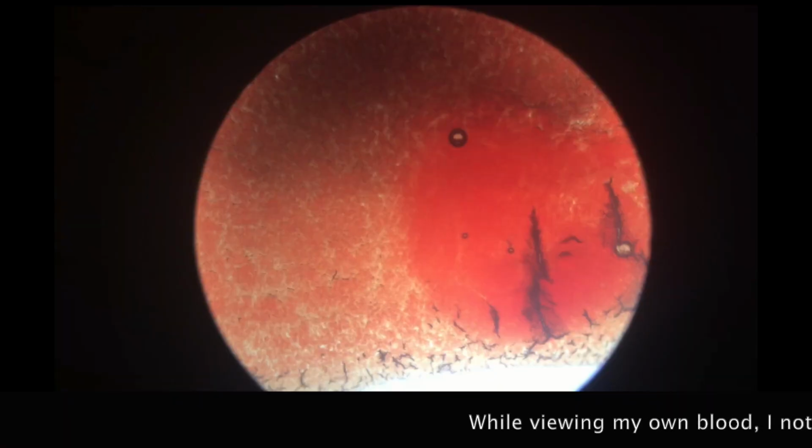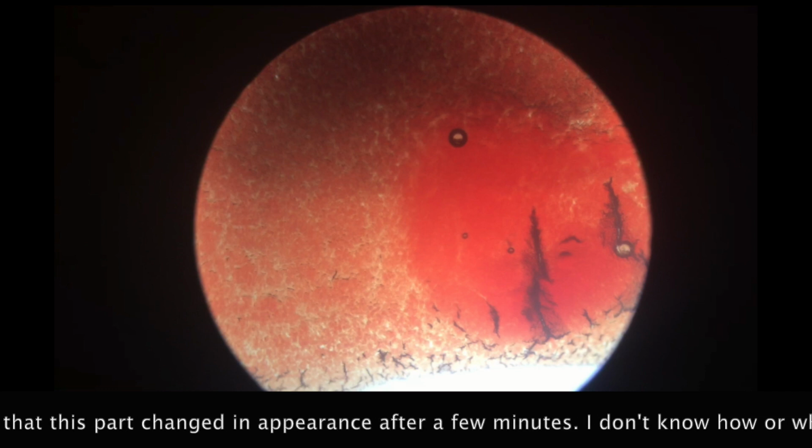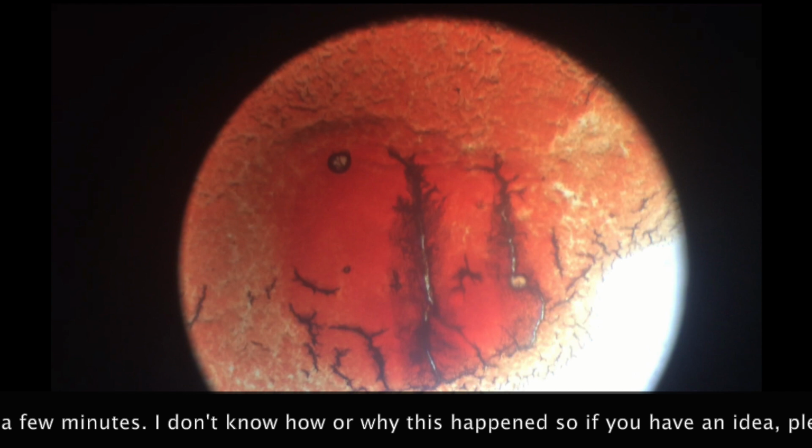While viewing my own blood, I noticed something strange. Look at this part. When I decided to find it again, it now looks like this. Very different from earlier, right?